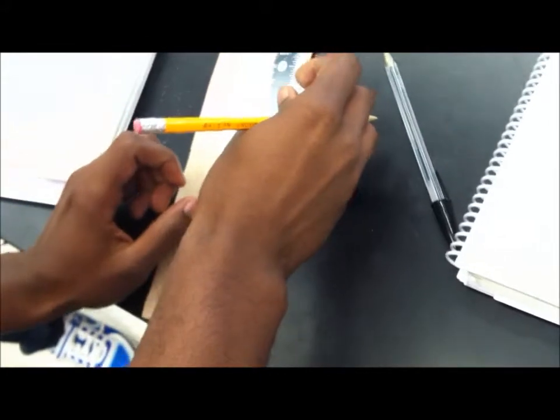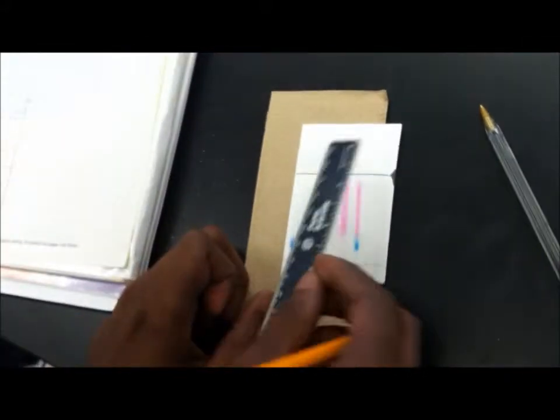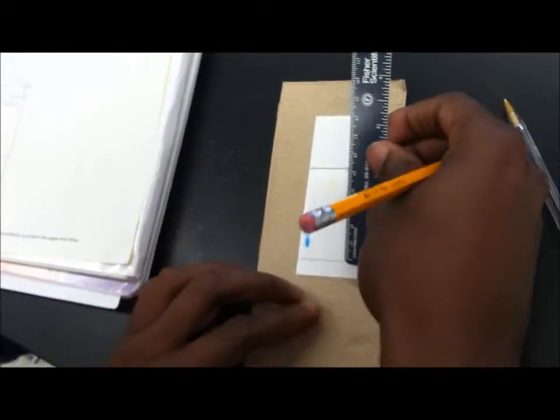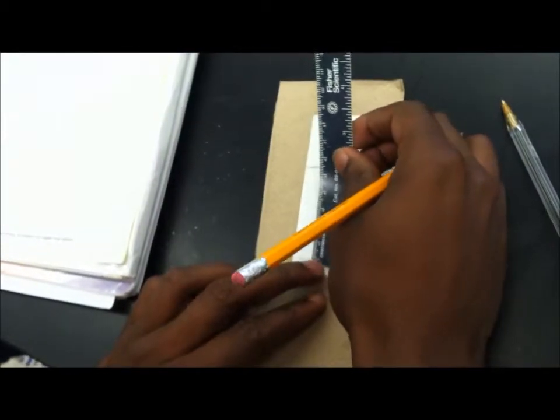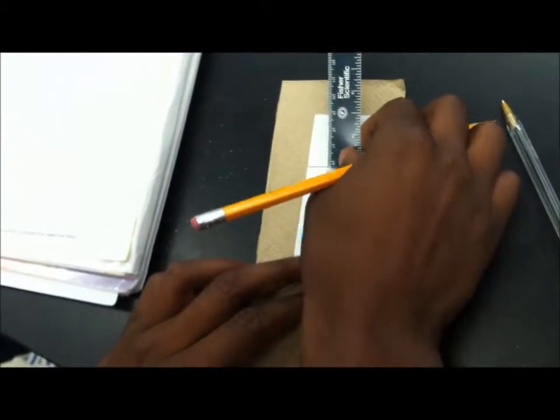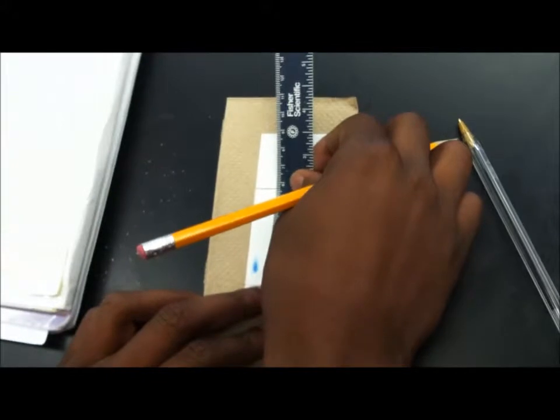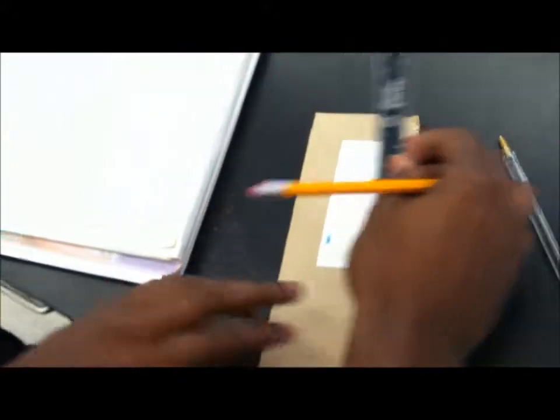All right, now we're going to come back over here to this. And we're going to document this one. You can barely see it, but it's there. And we're going to go from here to here. And we're going to measure it at about five and a half centimeters.